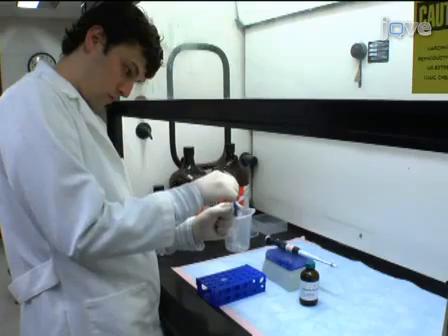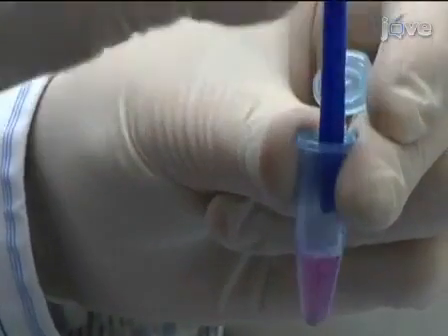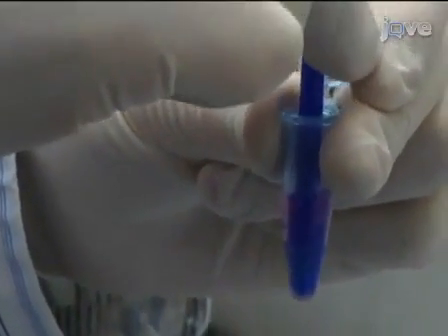Use a pellet pestle to lyse and homogenize the embryos for approximately 20 strokes until the tissue is sufficiently disrupted.